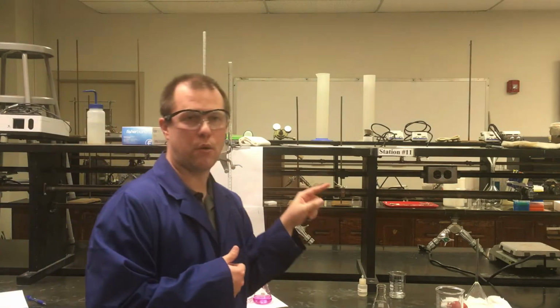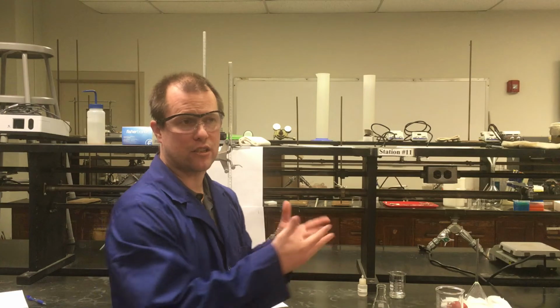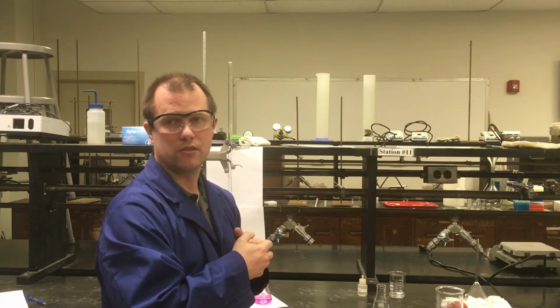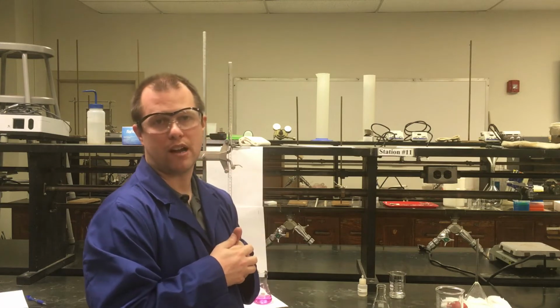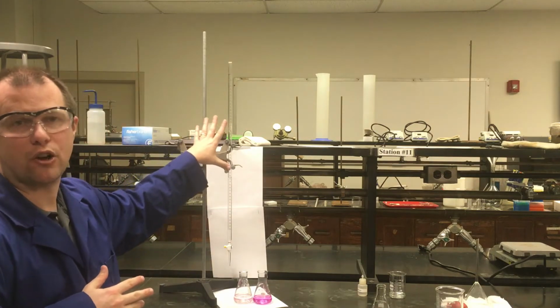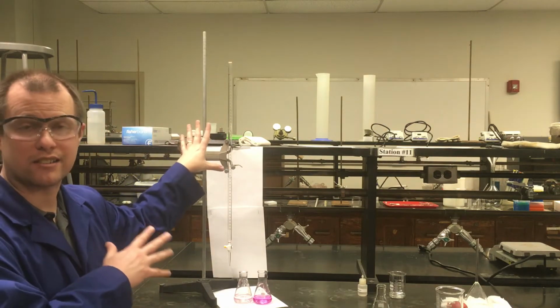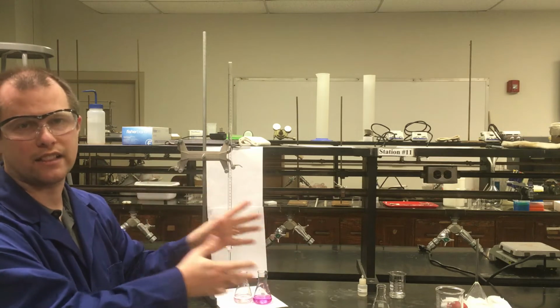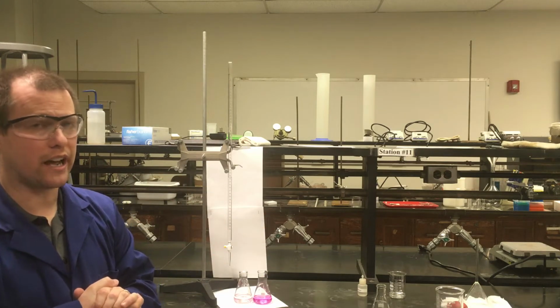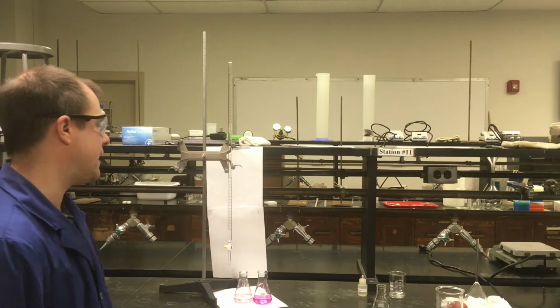Once we know moles of NaOH, if it's an acid-base reaction, in this case, it's a 1-to-1 stoichiometry for the acid and the base. So for every 1 mole of the sodium hydroxide we have, that's 1 mole of our hydrogen tartrate that should have been in our starting solution. So knowing the concentration and volume of the sodium hydroxide that we add lets us find the concentration eventually of our hydrogen tartrate that we're starting out with. So that's, again, the general layout of things.